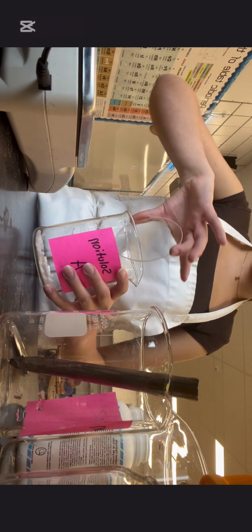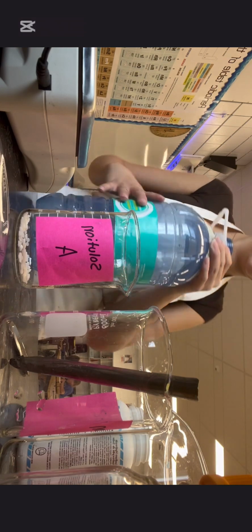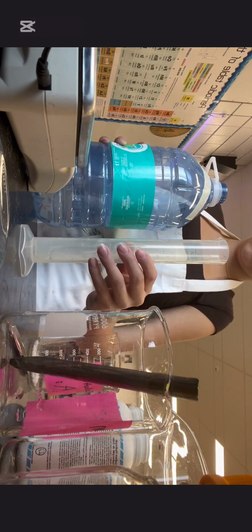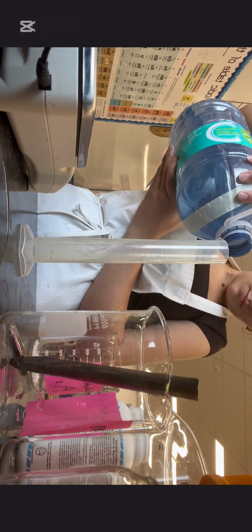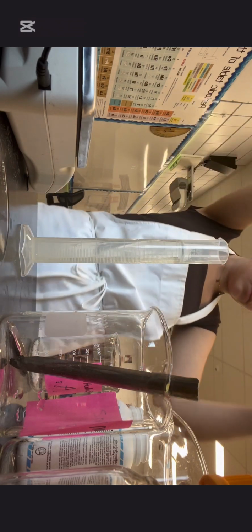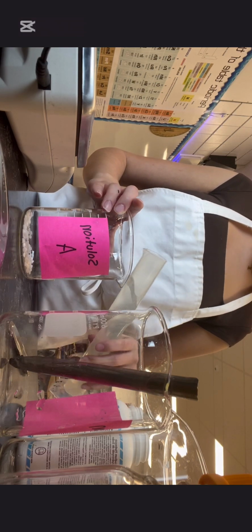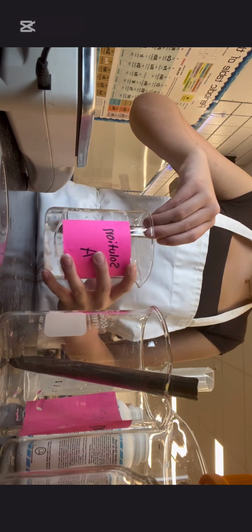This reaction can be repeated by shaking the solution, as we saw. This reintroduces the oxygen into the solution, oxidizing the indigo carmine once again. The solution combines with air when shaken or poured out, as I was doing when I poured both solutions back and forth, and the oxygen oxidizes it to green once more. In this reaction, the glucose is the reducing agent as it becomes oxidized and gives away its electrons.